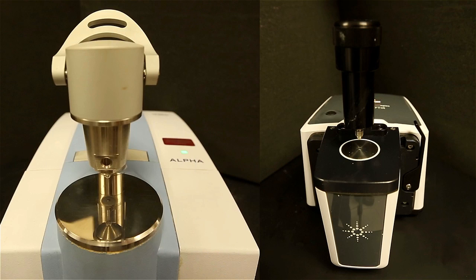The infrared spectrometer is a very useful tool in analyzing the purity of your sample and also deducing the identity of an unknown compound.